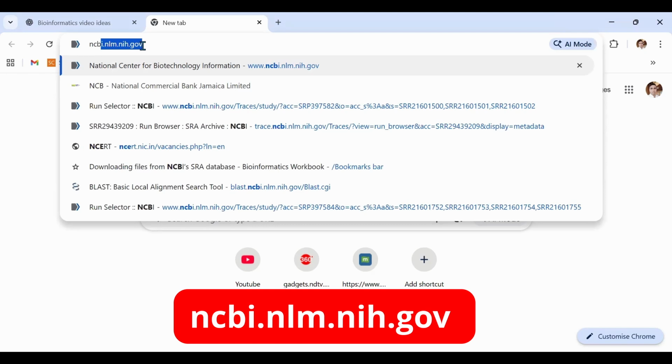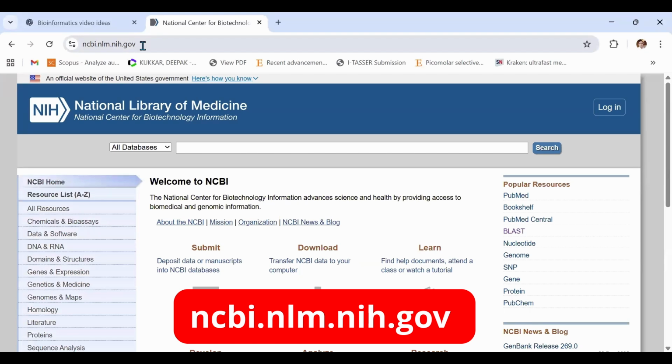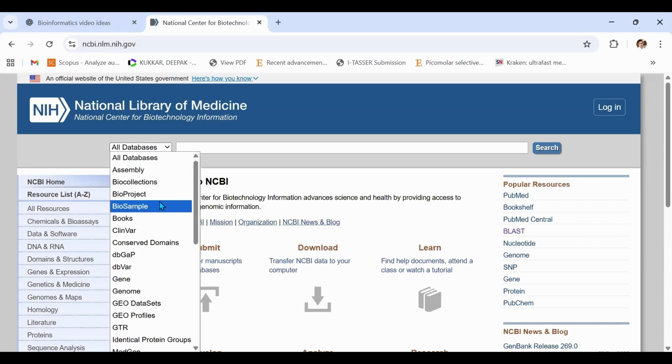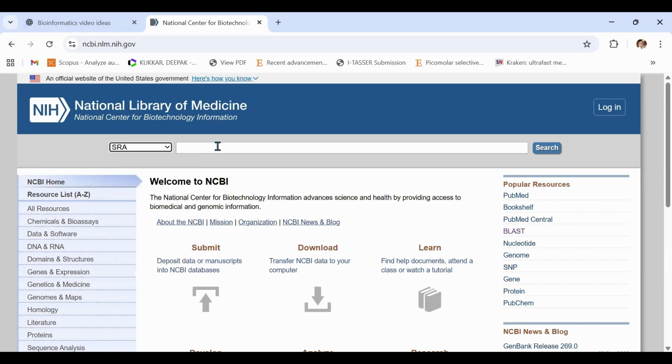For downloading your sample metadata file, in your browser web page, type ncbi.nlm.nih.gov, or you simply can type NCBI, and from the search options you will be able to access the NCBI homepage. Once this homepage is open, click on the all databases option, and you will see a drop down menu. Scroll down this drop down menu and you will see an option called SRA. Select this option, then type the name of the SRR file you want to download. For example, I'll type here SRR21601752. Once you have typed the number of your SRR file, hit the search button.